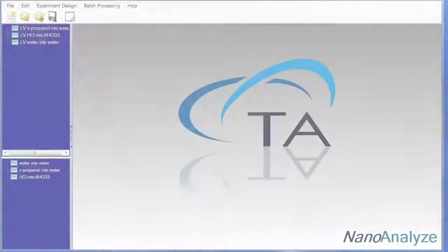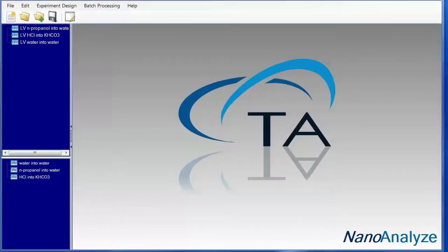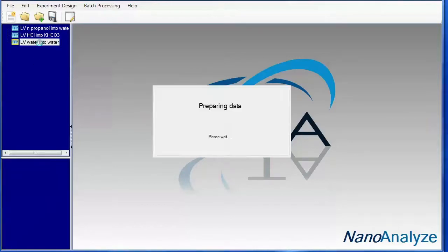TA Tech Tip will cover the data analysis associated with validation kits. All of these data sets were collected on a low-volume instrument. However, the fitting principles shown here can also be applied toward the standard volume instrument as well. The first set of data in the validation kit is the water into water.